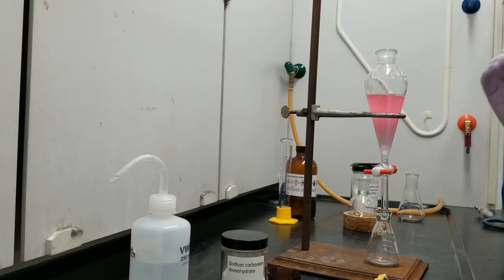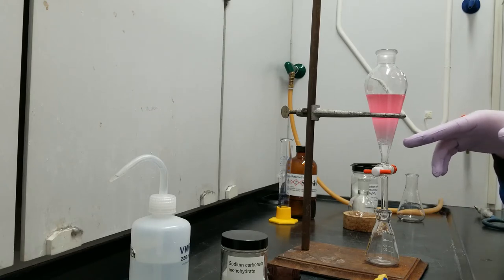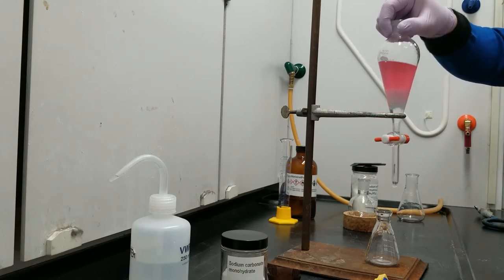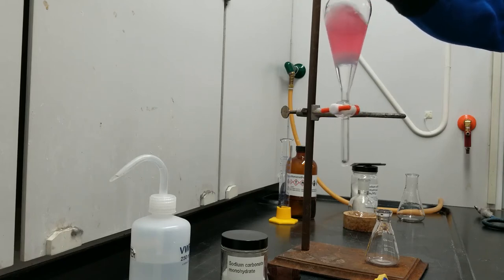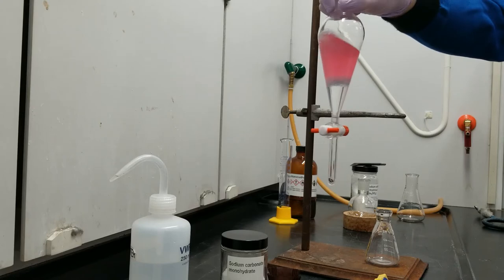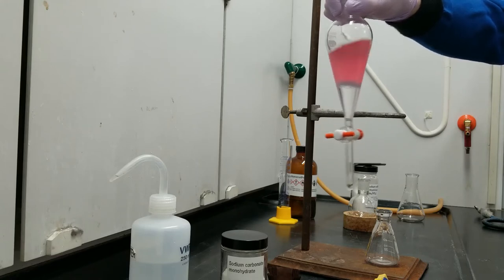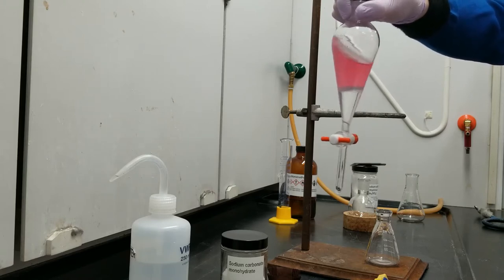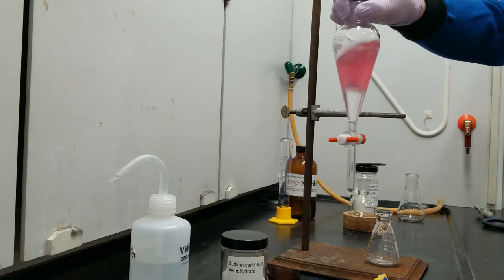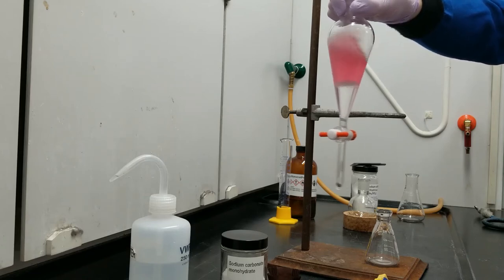And ta-da. So this has created an emulsion, which is like a foam made of a liquid and another liquid, which don't mix. But you can see as it rests, the emulsion is breaking. The DCM is settling in the bottom while the water layer is returning to the top. Now, the dyes that were in the energy drink are remaining in the water layer, which is why the top layer is still the colored one. The caffeine and DCM are both colorless. So that's going to be just a clear bottom layer. You can see me kind of wine swirling this container. That's to gently break up the emulsion and speed up that process.